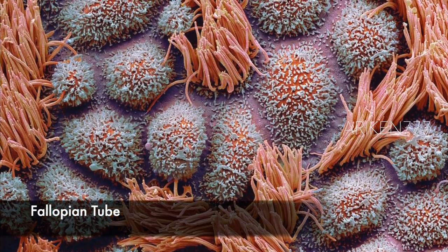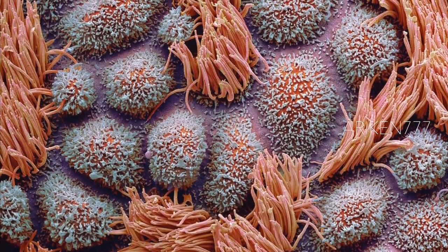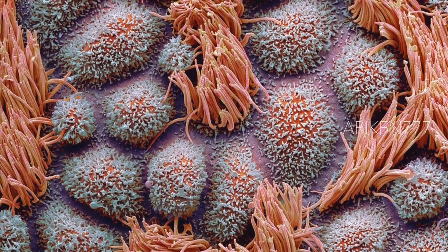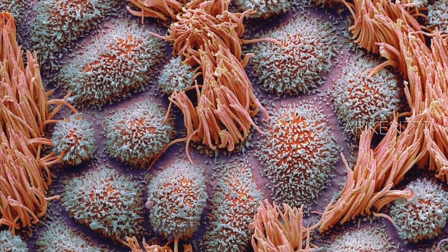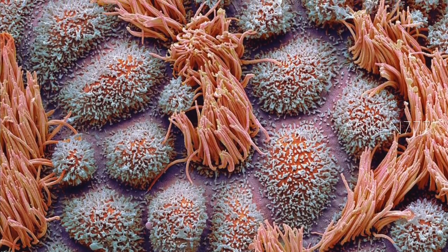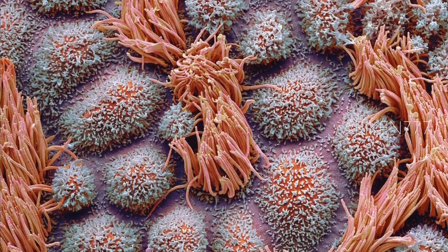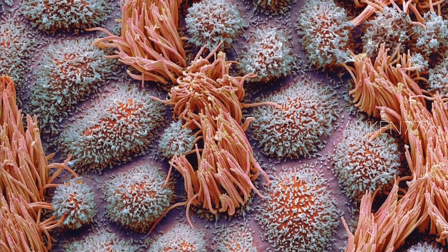The surface of a human fallopian tube. Fallopian tubes are ducts that lead from the ovaries to the uterus. The epithelium consists of columnar cells, many of which have cilia seen here in pink. The cilia beats towards the uterus, aiding transport of the egg from the ovary. Colored blue are the secretory cells with their microvillus projections. These cells secrete a substance that maintains a moist environment in the tube and may provide nutrients for the egg.